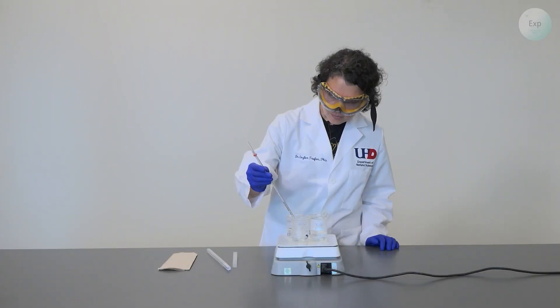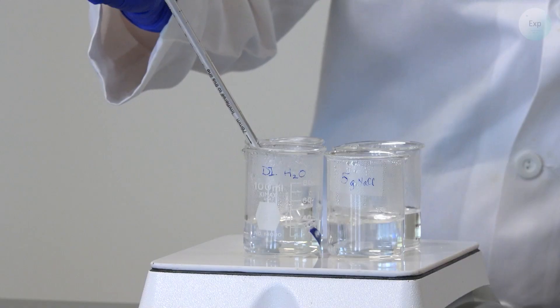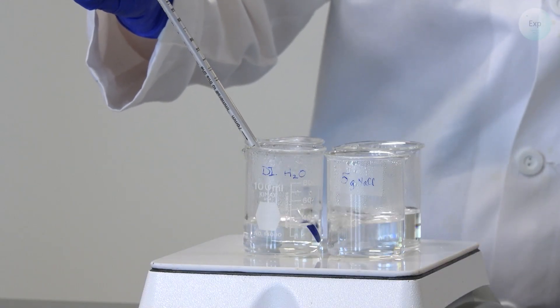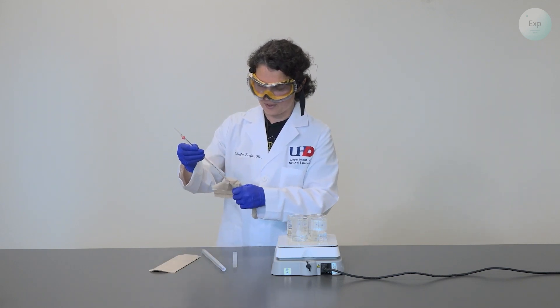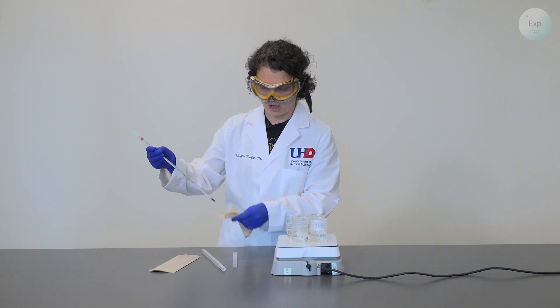The temperature of our boiling water is 99.2 degrees Celsius. Then we extract our thermometer, wipe it, careful because it is hot.